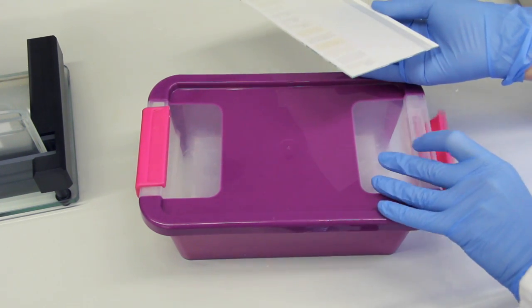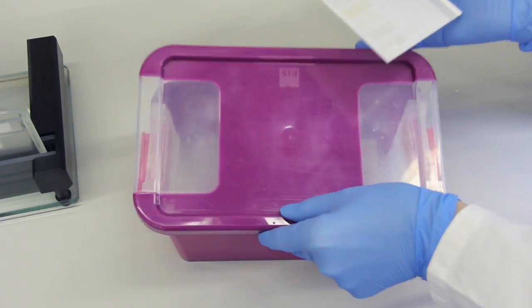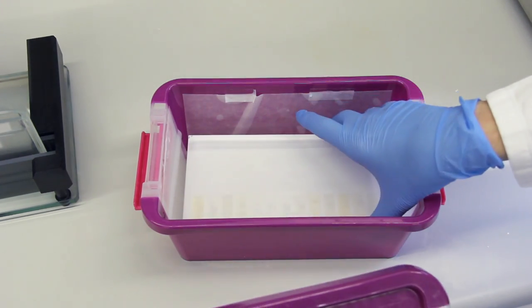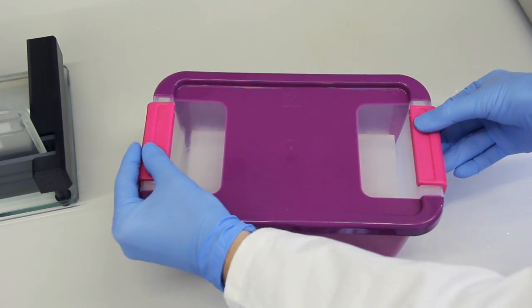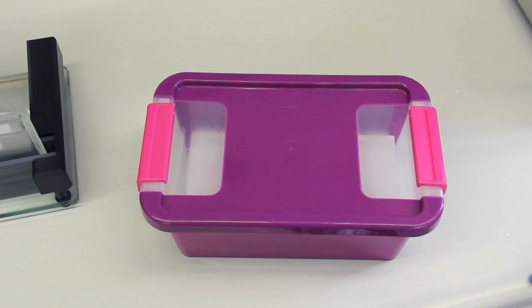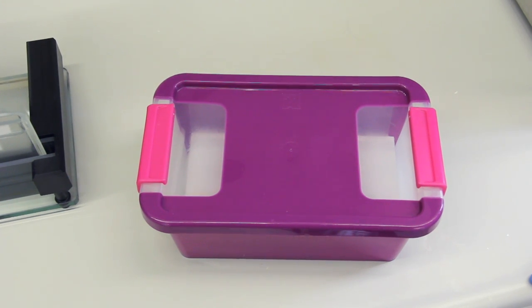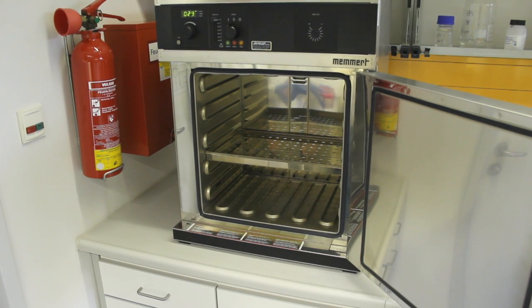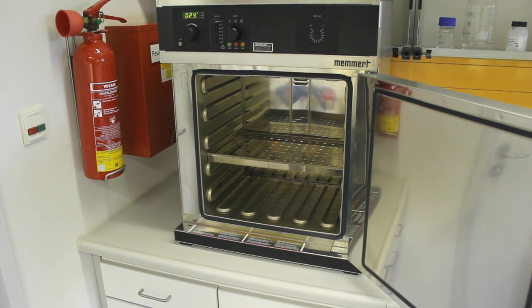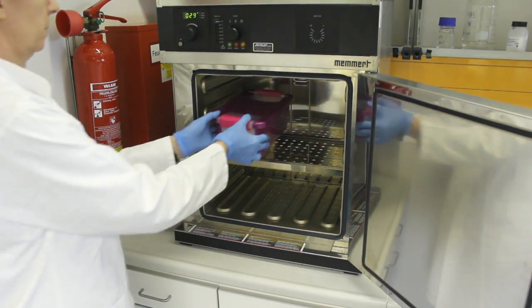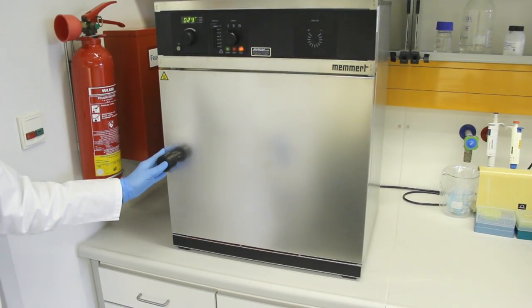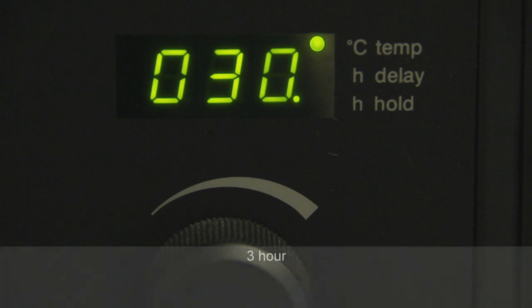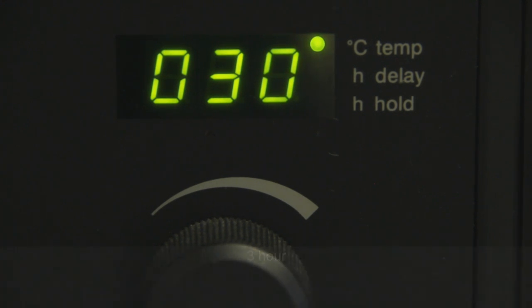The glass plate's rear was cleaned with a tissue and the seeded plate was horizontally incubated in a plastic box with an almost 100% humidified air surrounding. The box was lined with filter paper, wetted with deionized water and stored at 30 degrees in the incubator one hour prior. During the incubation, any estrogen-effective compound zone in the chromatogram that interacted with the human estrogen receptor finally released galactosidase. In the incubator, the incubation of the plate was performed at 30 degrees for 3 hours.